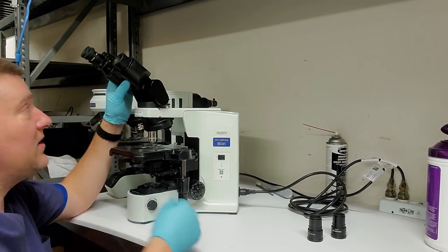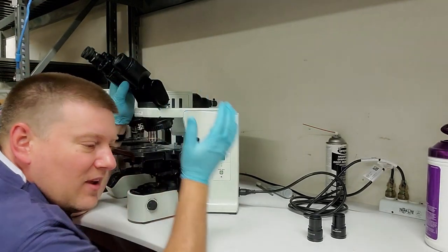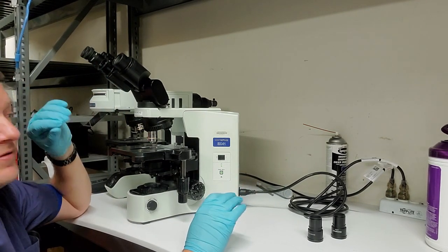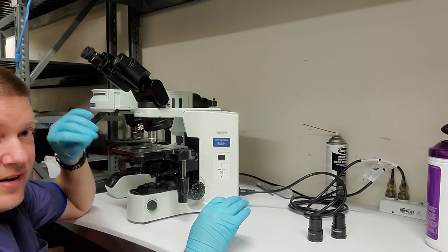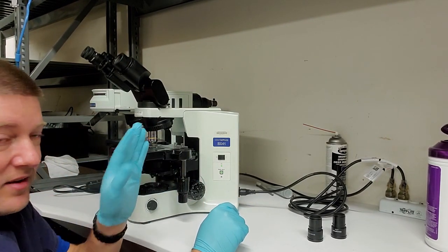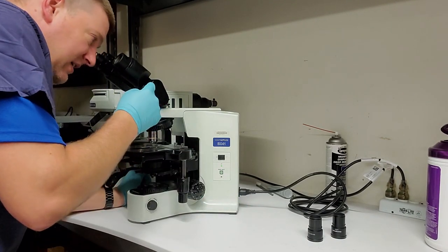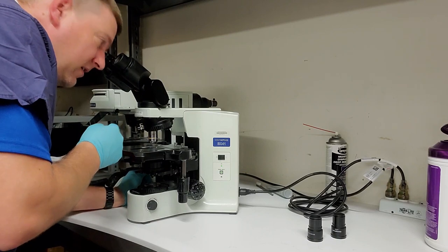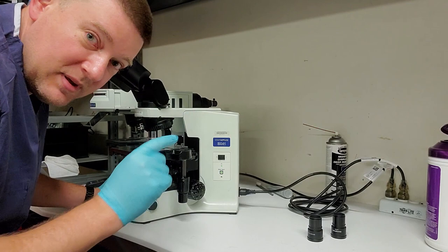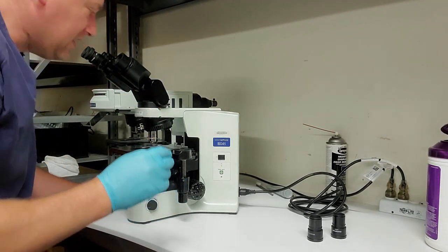Because if you shove something down the binocular and you dirty the glass inside here, it's going to be an absolute nightmare. Now, the best you can do is maybe puff some clean air down in there. I'm not talking about breathing. Your breath has got all sorts of contaminants that will dirty that. It's very rare that these are dirty down inside here anyway. But I get a good look, make sure there's no chips of glass or no surprises, like maybe a floating piece of glass that's down inside the tube does happen, especially if they're rough handling.